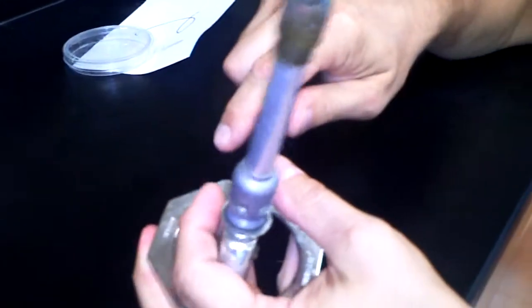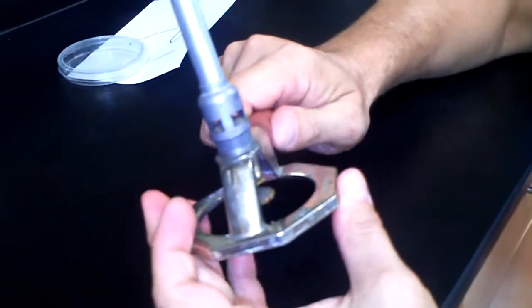Until you can see the brass nut here. And then reattach your hose. That is how to take apart the Bunsen burner.